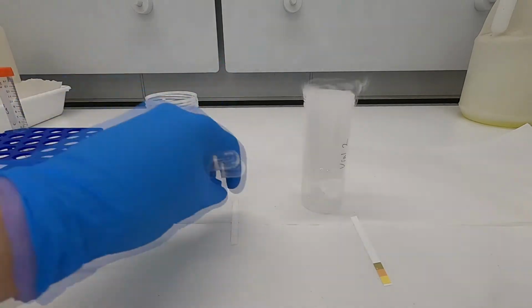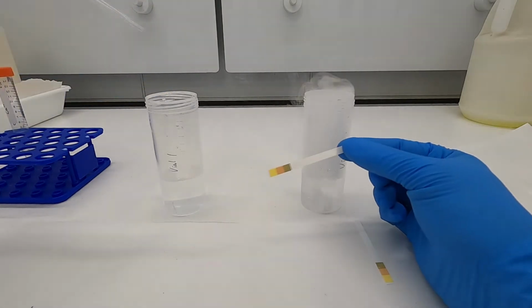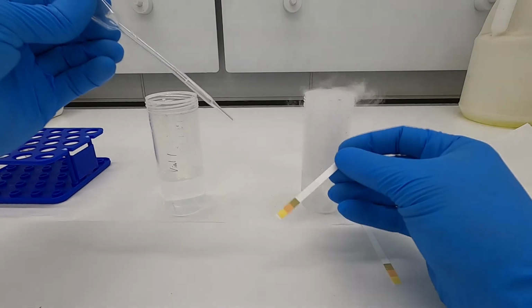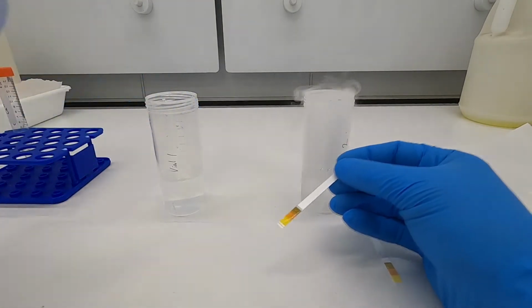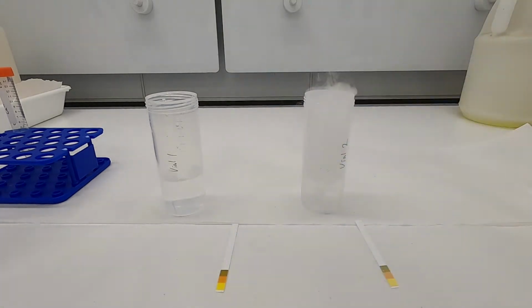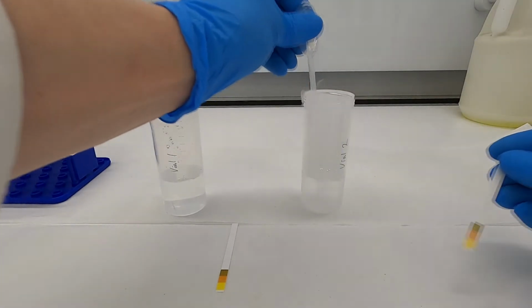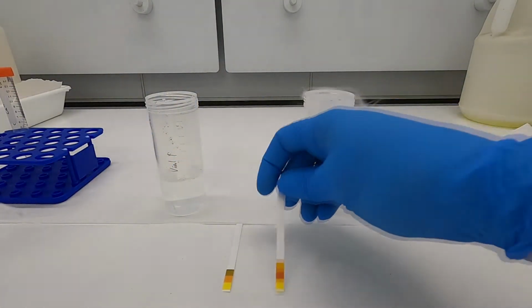remove a small amount of water from the vial and add it to the indicator paper. Okay, so we can use a plastic pipette. And you don't need a lot. 1, maybe 2 drops at the most is all you need. And then if you remove some of the excess water and let that sit, it'll give us our value. Okay, I'll do it for the second vial here as well. Okay, remove the excess water, lay it down.